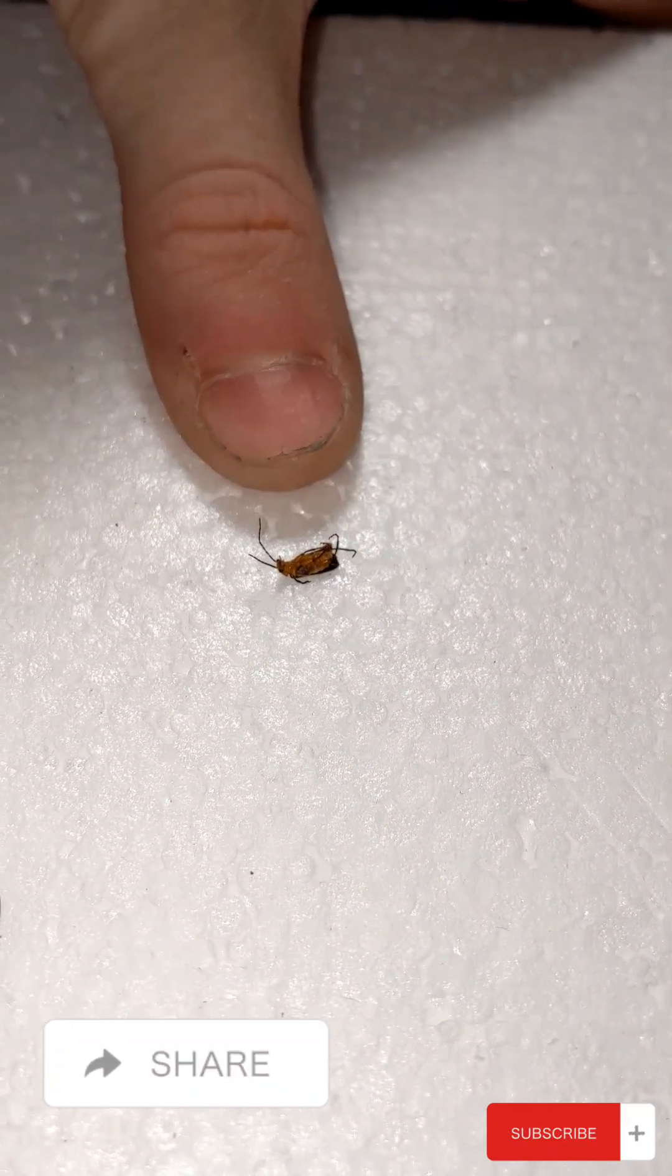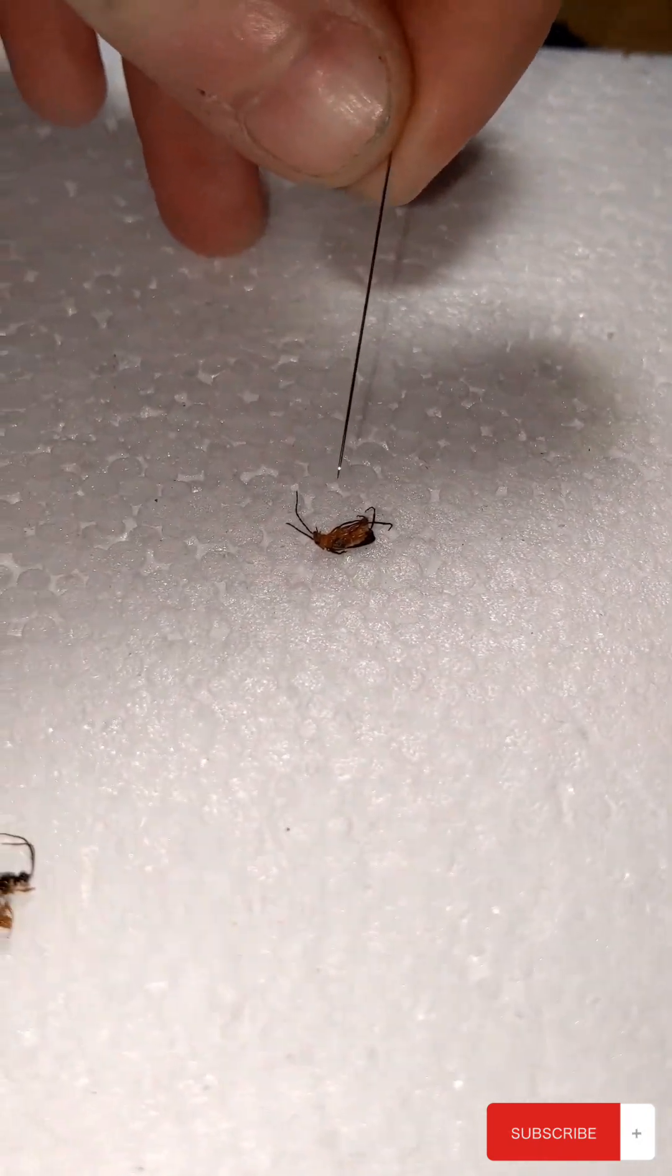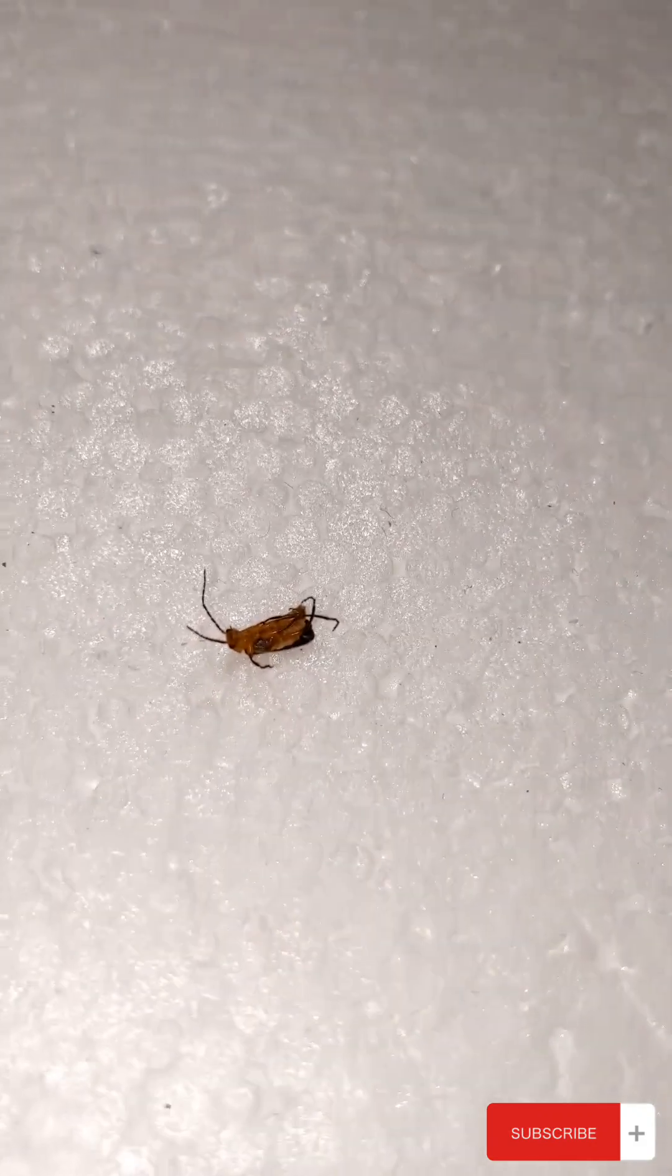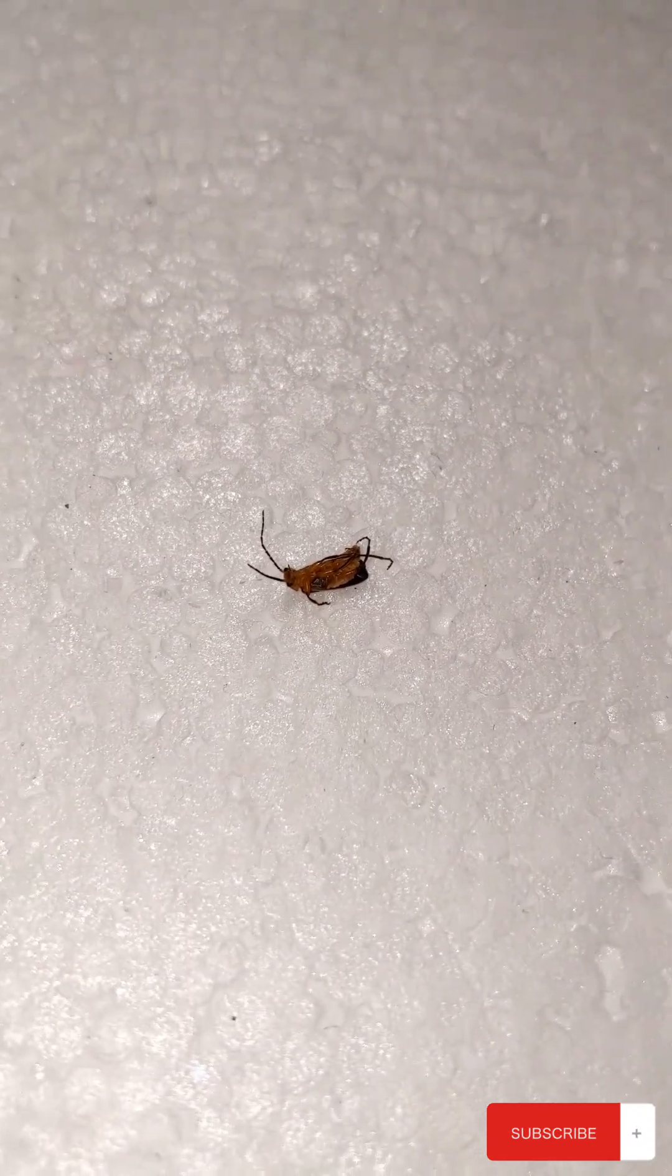Today we're going to be pinning specimens that are a little bit too small to put a pin through as it would probably damage a specimen. This works for small beetles, wasps, etc. So let's get to what you guys need.